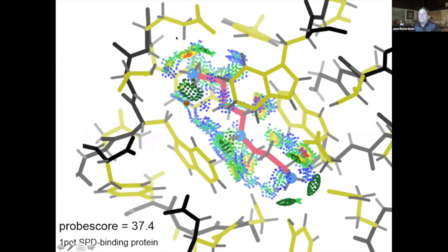So here's another example. This is a spermidine, which is a very difficult ligand fitting example. Spermidine has NH3s at the ends, and it has a single NH2 near the middle, but it's not at the middle. And so you could fit it with the nitrogen here or with the nitrogen here by flipping the whole molecule over backwards. And so this is showing one version of a good spermidine fit in a protein that is actually a spermidine binding protein. And it does a lot of it with van der Waals contact, actually. There are pairs of aromatics here that hold it. And this one gets a probe score of 37.